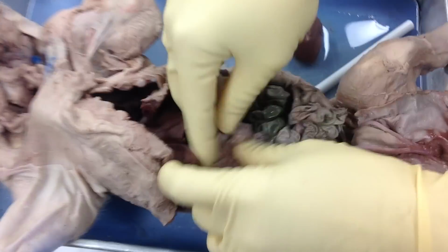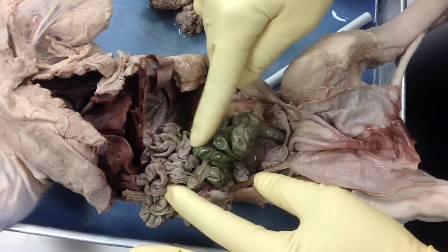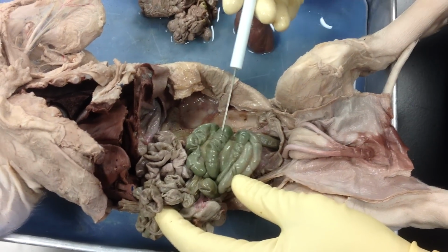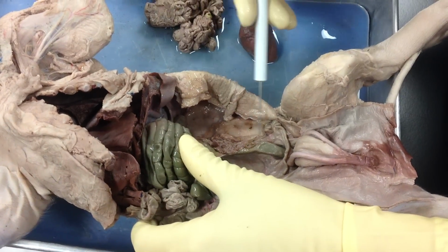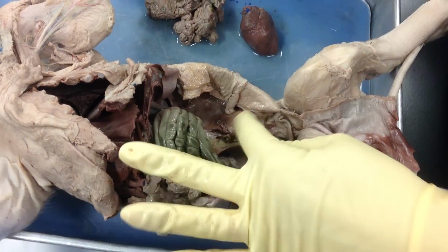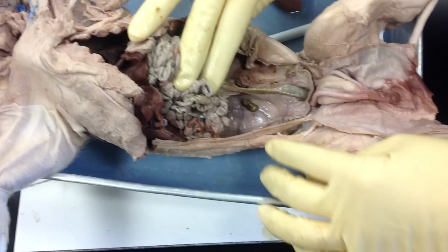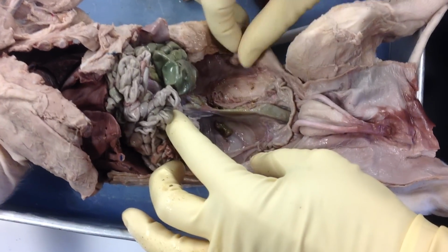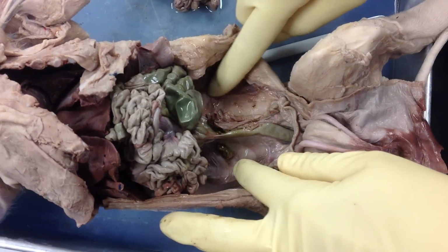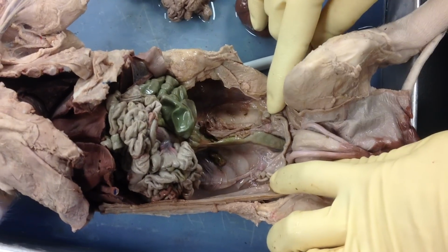So after I go from my small intestine, I reach my large intestine, which you can tell the difference in. Okay, it's green, it's thicker, it contains feces, right? And it ends up exiting the piggy, okay? So also on this pig, I want to show you, if I've pushed the organs up, I'm probably looking to talk to you about the renal system, the system that the kidneys are a part of, or I'm looking to talk to you about the reproductive system.